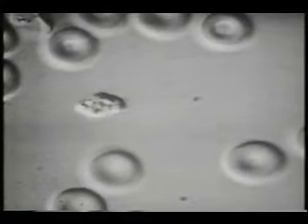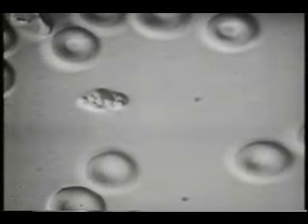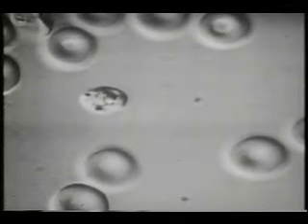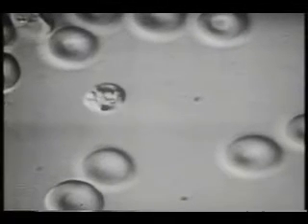Vesicles have appeared on the erythrocyte cell surface. These vesicles disappear as the cell elongates and swells. Note the movement of individual Merozoites within this cell just prior to the sudden explosive rupture. Some Merozoites are free of the residual body at the time of rupture.